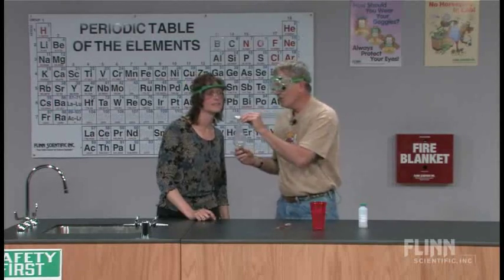All right, let's try one more time. Did you hear anything that time? No. No sound that time. Yeah, I didn't hear anything. It didn't go. So, well, it must be true if it doesn't go.